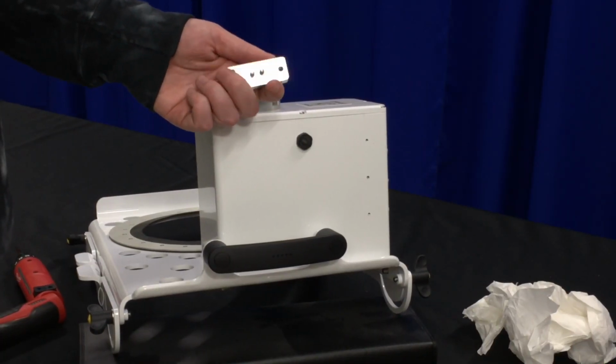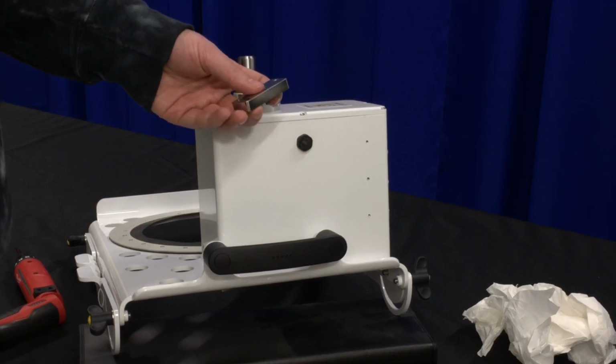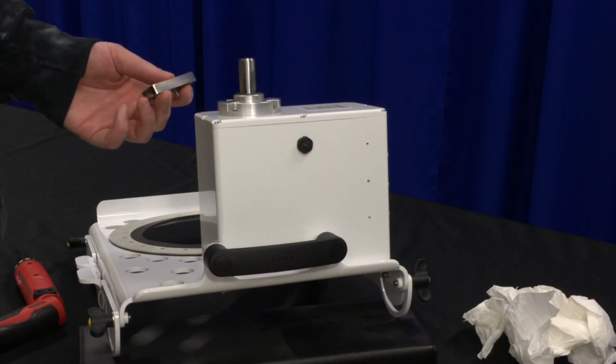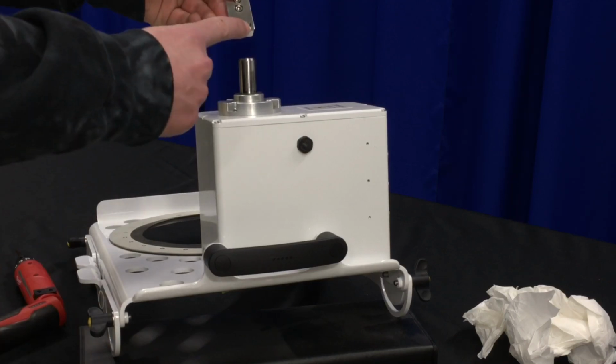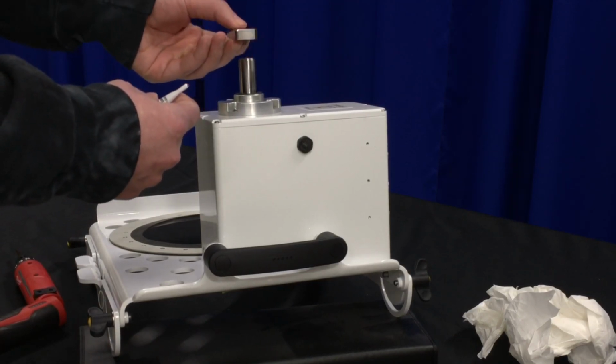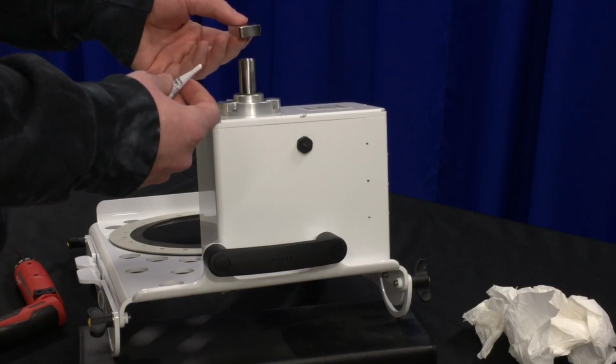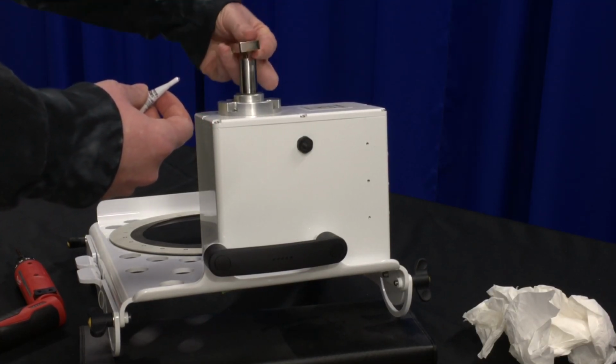Next step is to put the column adapter back on. If your chamber was originally closed or parked, then you will want this facing towards you. If it was open, you will want this reversed.